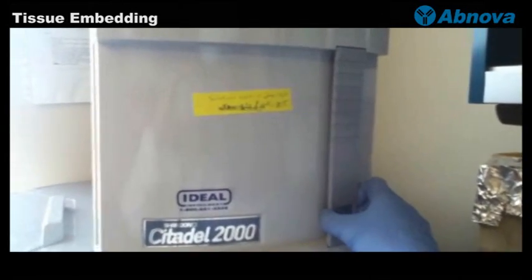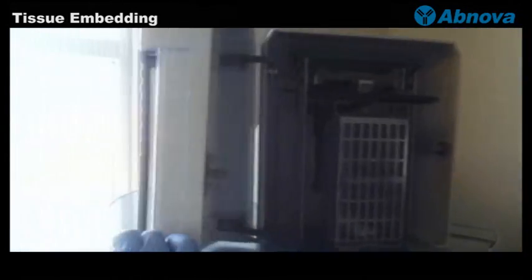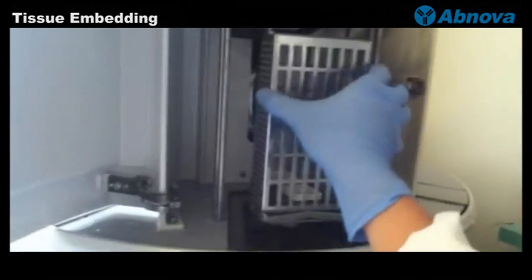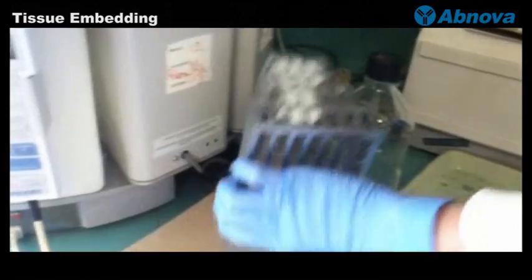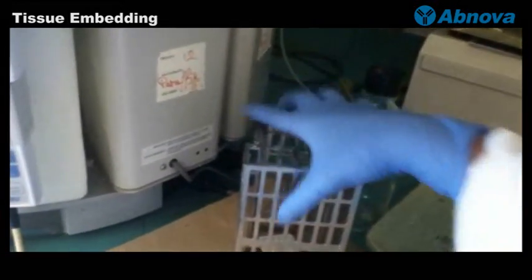After it has been processed for 17 hours, we can take it out because it's fully done, and then we can empty the tissue.